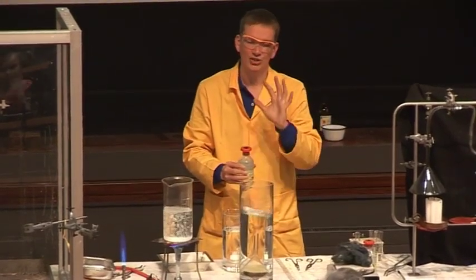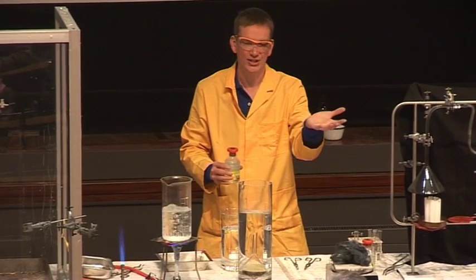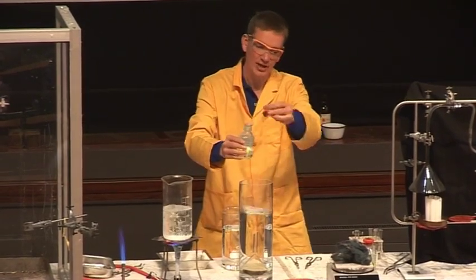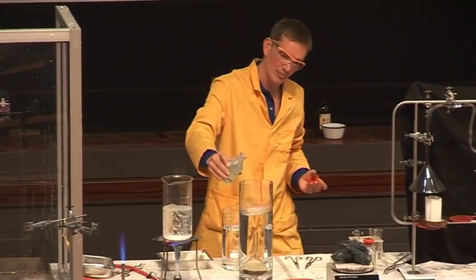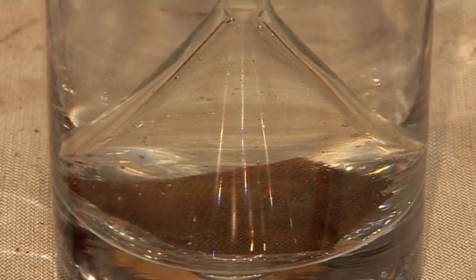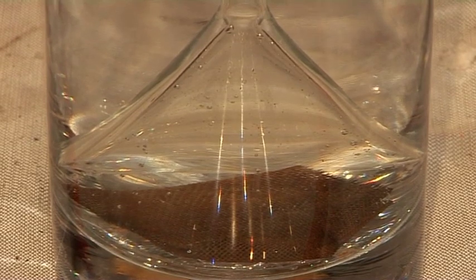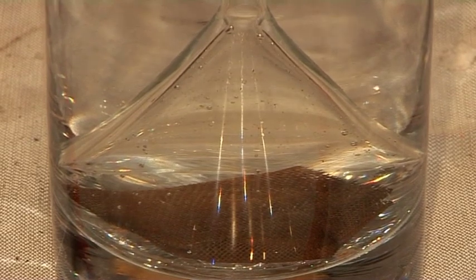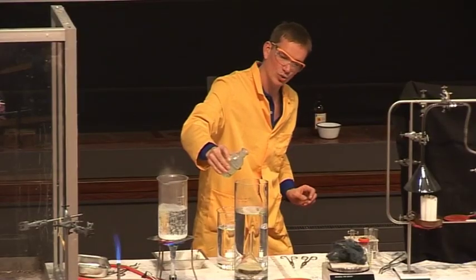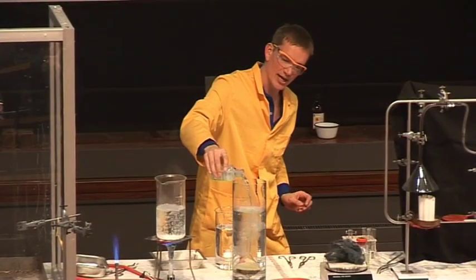As soon as this gas comes into contact with air — well, the methane we needed to light — this gas spontaneously catches fire. So I'm going to add some acid to the container here. In the bottom we have a funnel with a compound called magnesium silicide, and as soon as it comes into contact with acid, we get a gas called silane, SiH4.